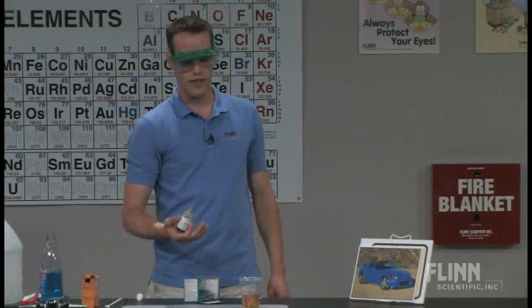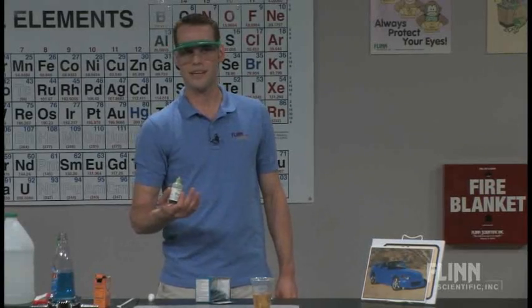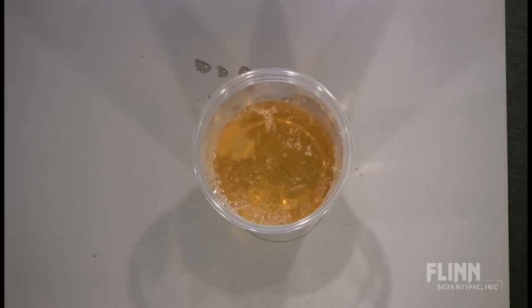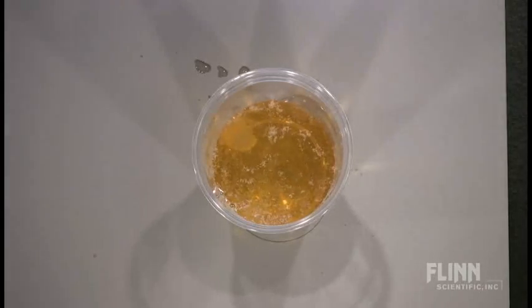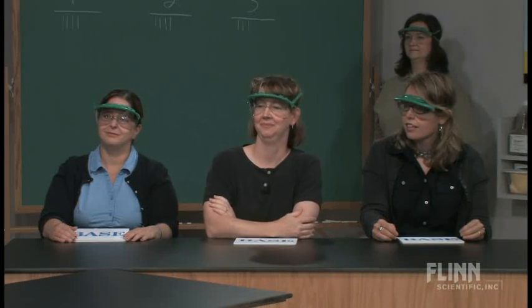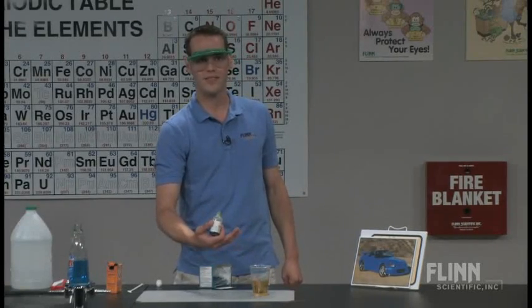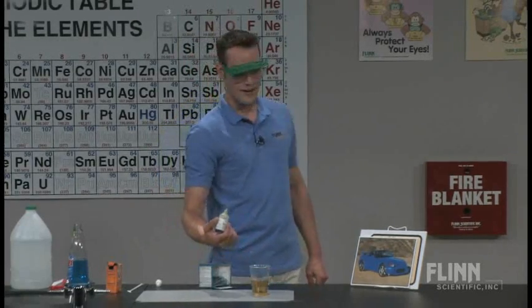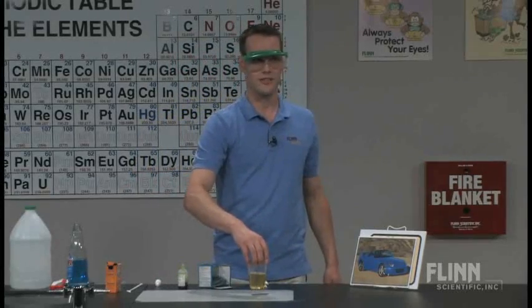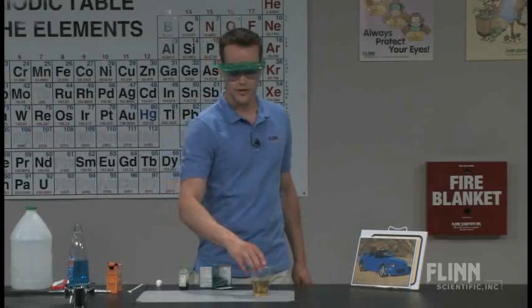Why would Alka-Seltzer be an acid? Well, when it first starts to dissolve, that plop-plop-fizz-fizz is carbon dioxide coming out. We have a combination of citric acid and baking soda in the same tablet that starts to cause that effervescence and sets up that CO₂ carbonate-bicarbonate buffer inside our flask. So we get an acid first. The interesting thing is if you let it sit, over time it becomes a little more basic as some of that carbon dioxide comes out of solution. My students think, 'Oh, Alka-Seltzer is an antacid — it's got to be a base.' But that's a really good one to open up a great discussion with your students.